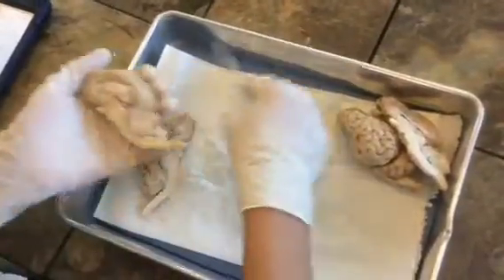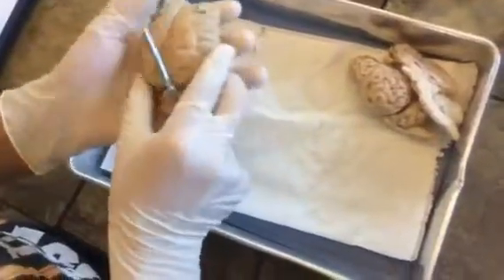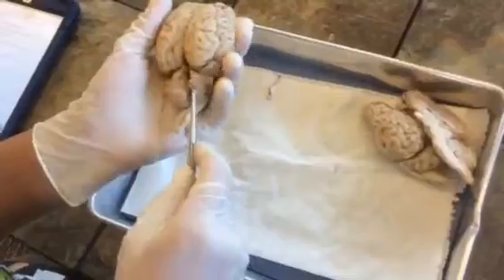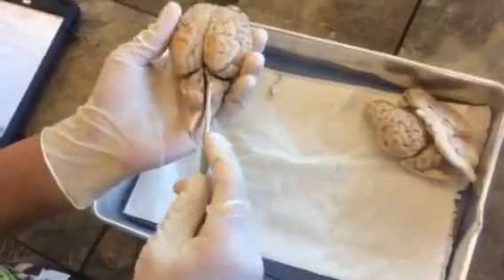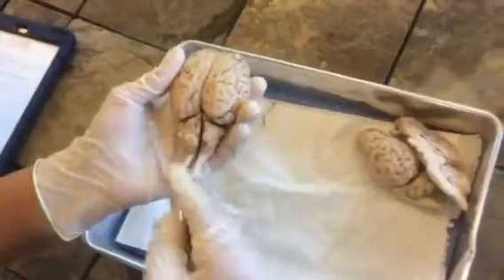And also, if we close the brain back up, or put it back together, so to speak, this part back here, some people like to call it the little brain. In technical terms, it's known as the cerebellum. It's important for motor control, coordination, and motor memory.